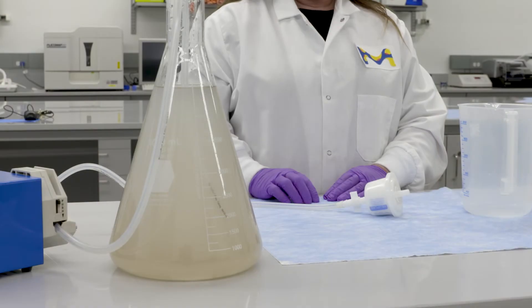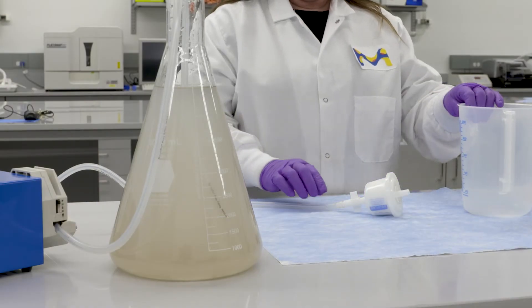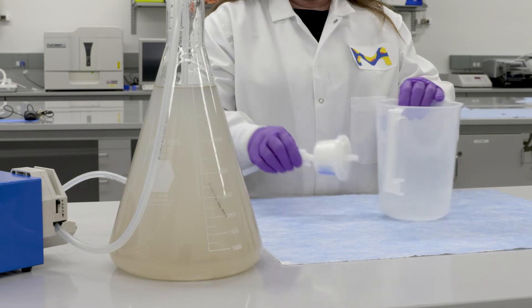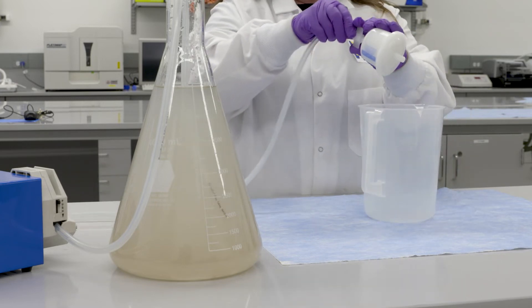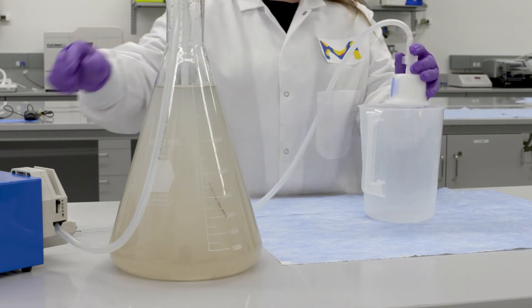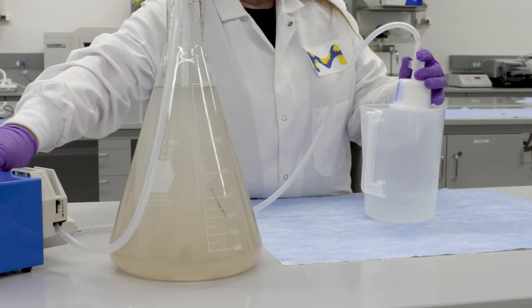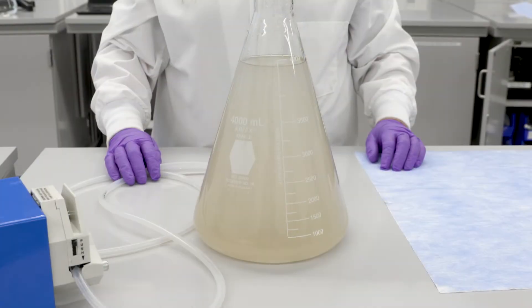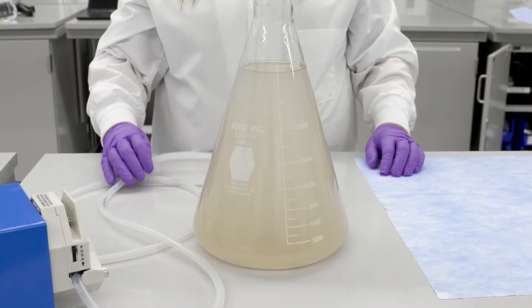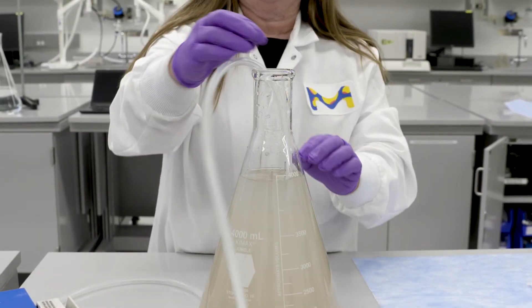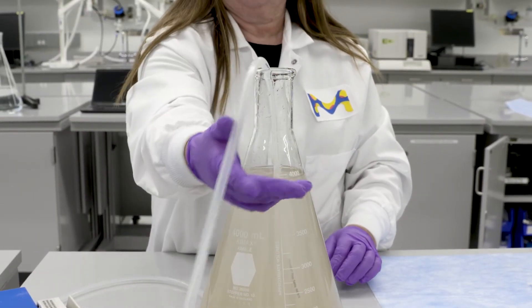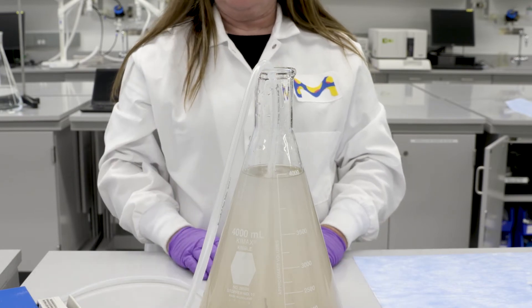Test setup. Prepare in-line filtration with the sampling capsule filter cartridge using standardized fittings and tubing. This can also be done right in the field with proper pumping equipment. Place tubing into a water source, typically submerged at least one to two feet below the water level. Here we'll use a laboratory flask to simulate the water source.